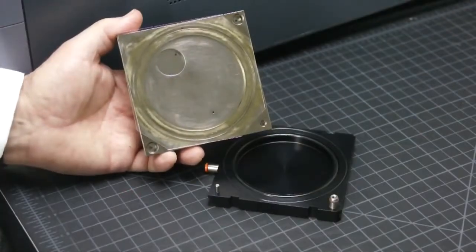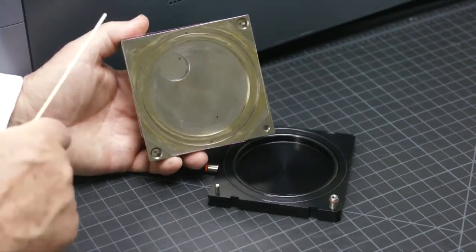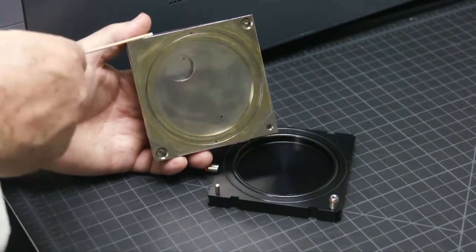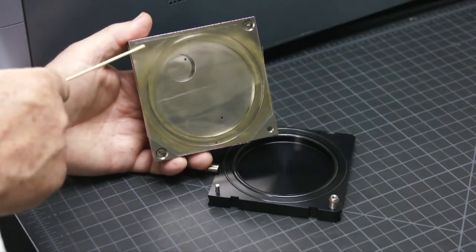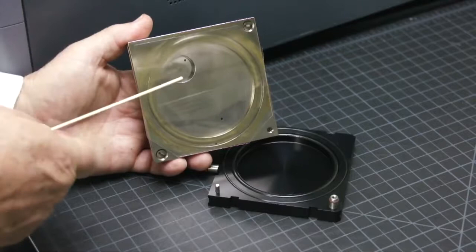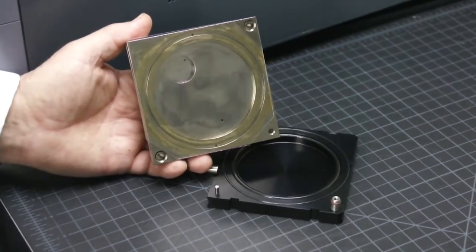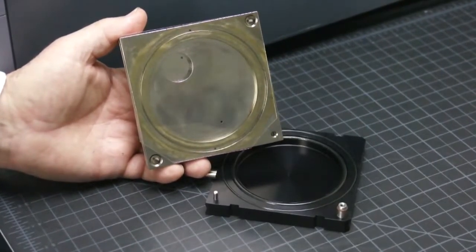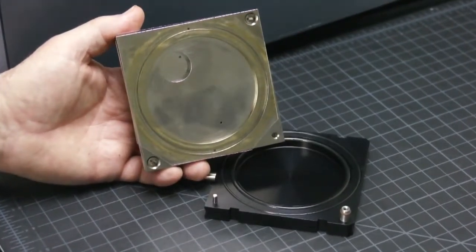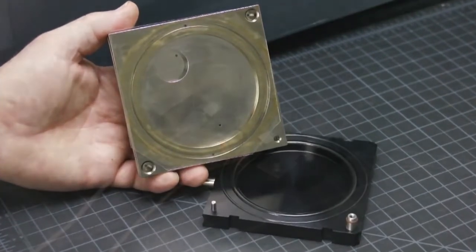Of course, we've installed MOCON's patented True Seal flush ring test cells. Their function is to remove any ambient air entering the cell between the film and the cell. The impact of this technology is to lower the instrument's baseline, effectively increasing repeatability 2.5 times. In addition, users may be able to eliminate the need to establish an individual zero, a pre-test function that typically doubles the total testing time.